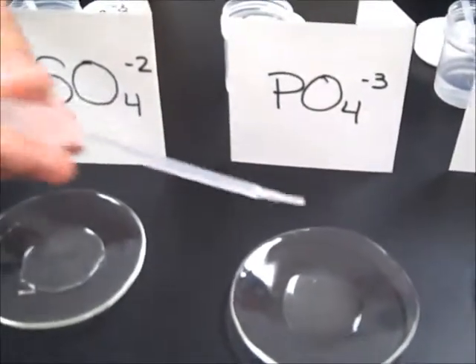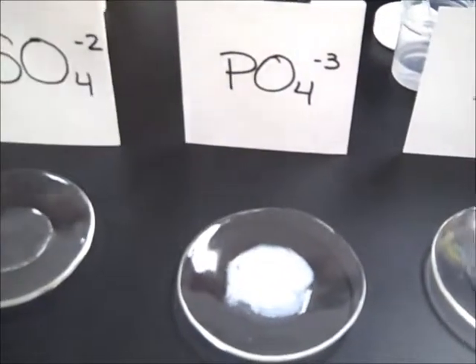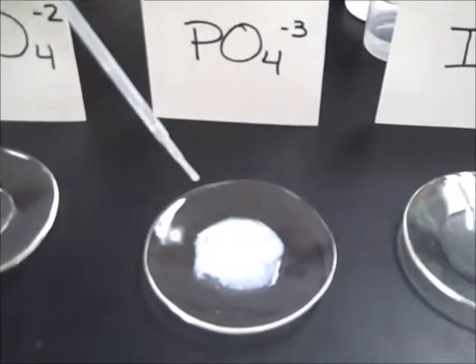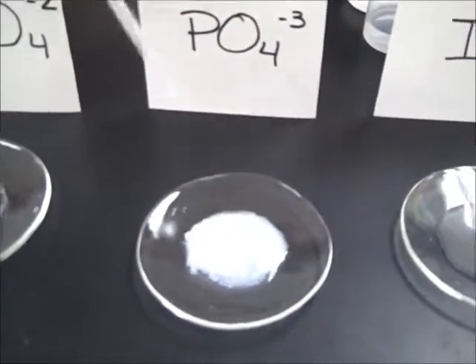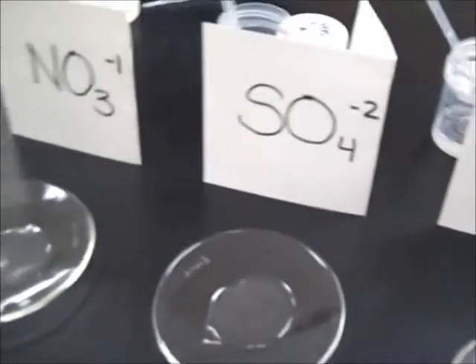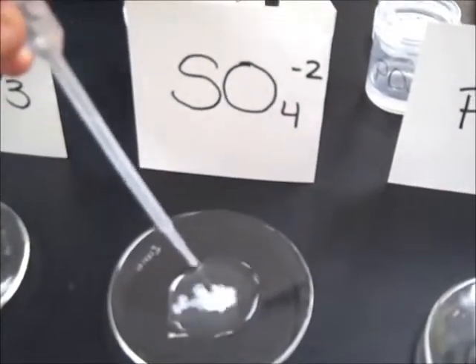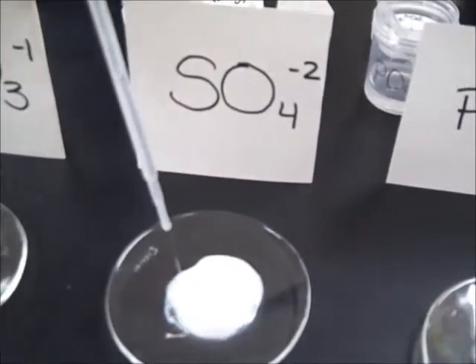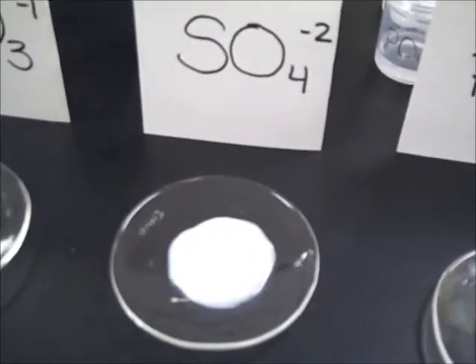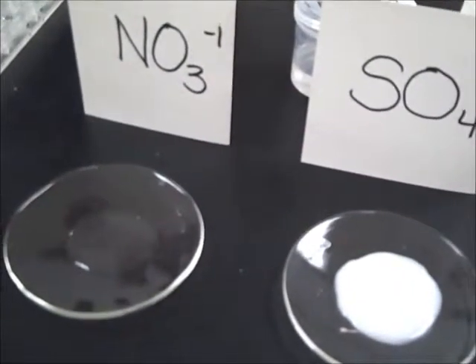It's going to mix barium and phosphate, the PO4. I like how when you squirt it, the color kind of comes out like that. Yeah, it's got to be fresh. Yeah, so that's nice. Okay. All right, to the next one. This is going to be the barium and the sulfates. See how it kind of, see what I'm talking about? Yeah, it's cool. Nice and milky white. And this is going to be the barium and the NO3 minus 1 ion.